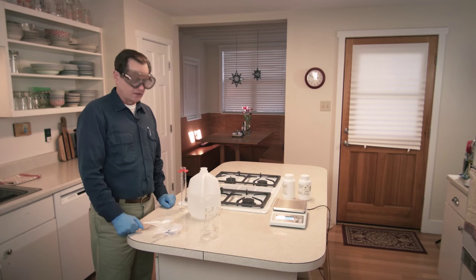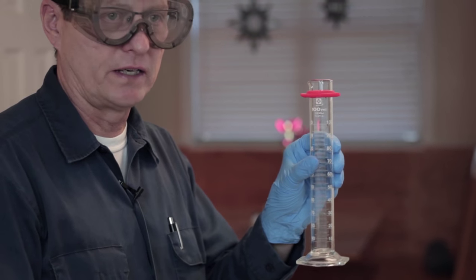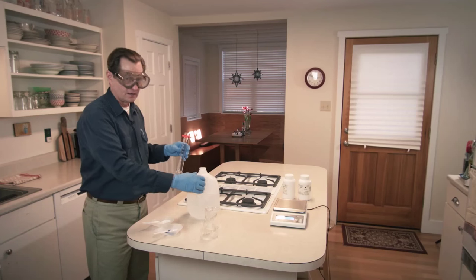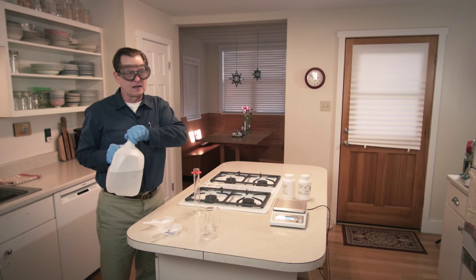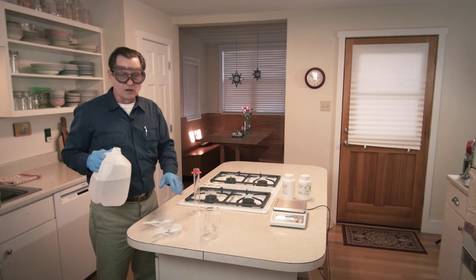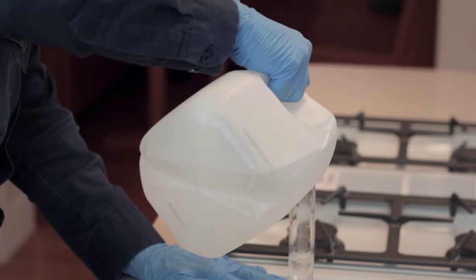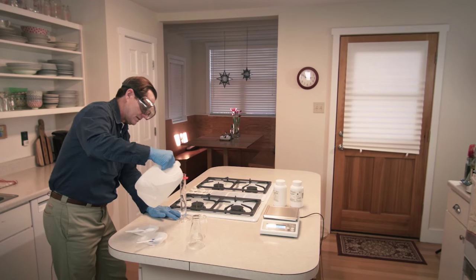Now I'm going to make solutions of these two compounds. You measure out liquid in a graduated cylinder — there are scales up and down. I'm going to measure out 75 milliliters of distilled water. We need to use distilled water because regular tap water contains dissolved salts that don't belong in these chemical reactions, so we bought a gallon of distilled water from the grocery store.